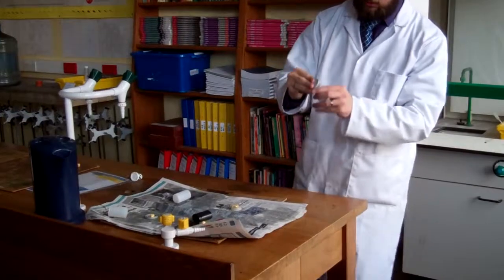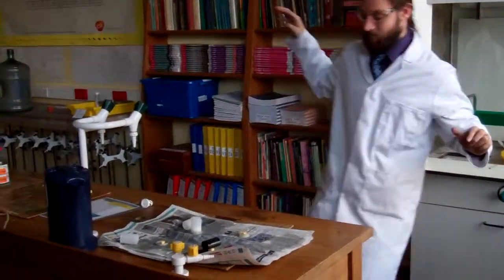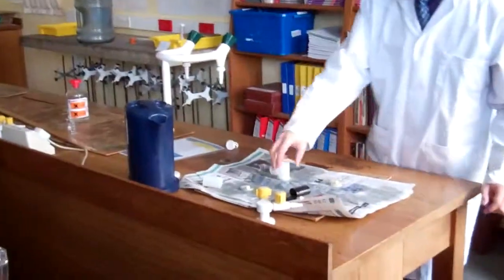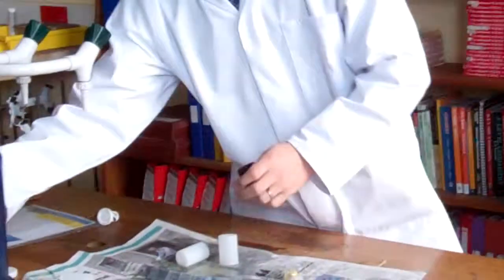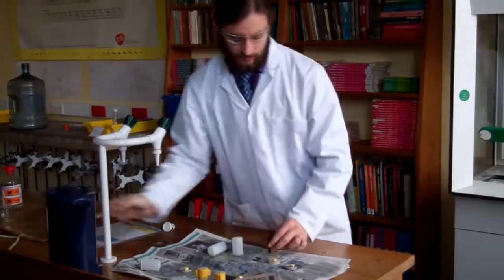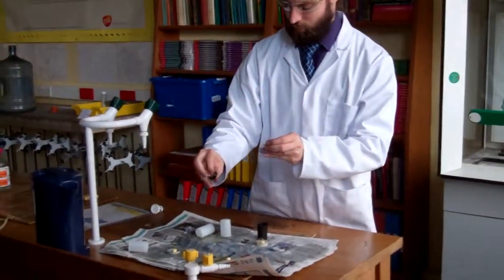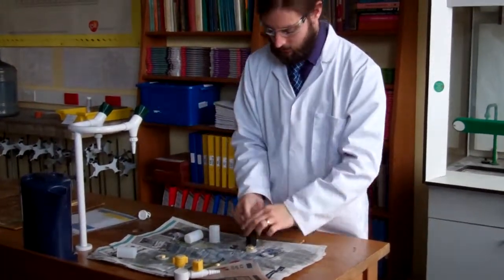So let's put the lid on nice and tightly. The lid's on very tight on these so they're not working too well. Let's see if we can get this one going again, because the black one should work quite well — it's a bit of a tighter seal on that.